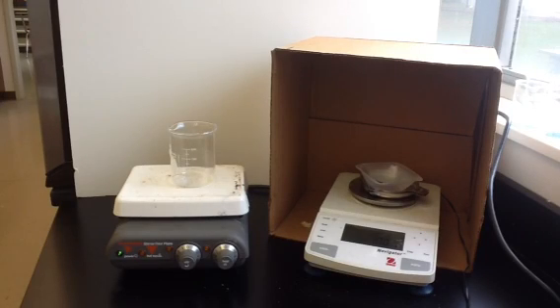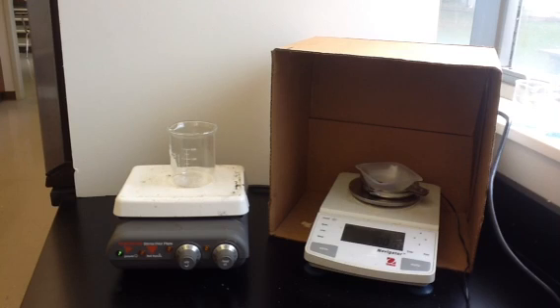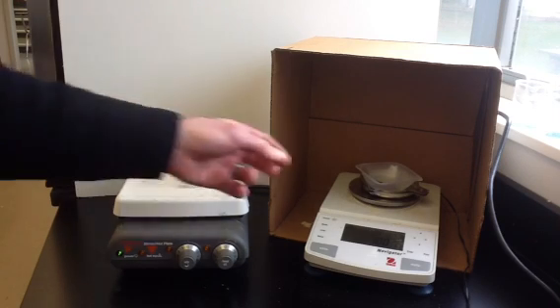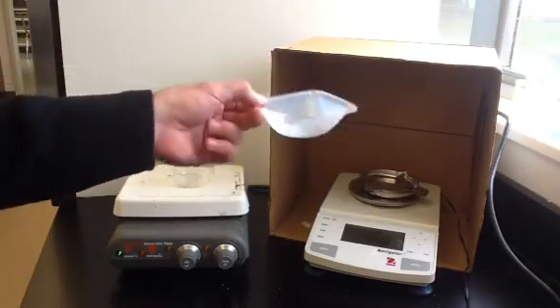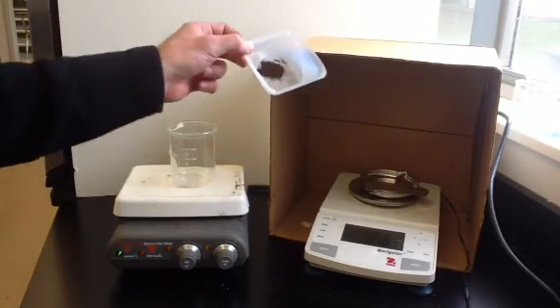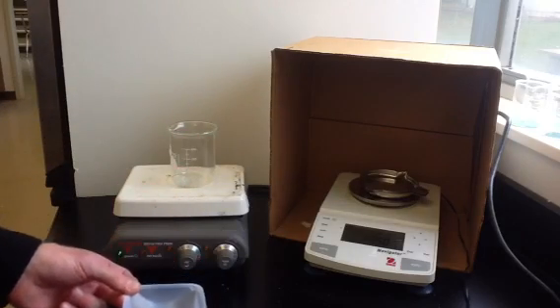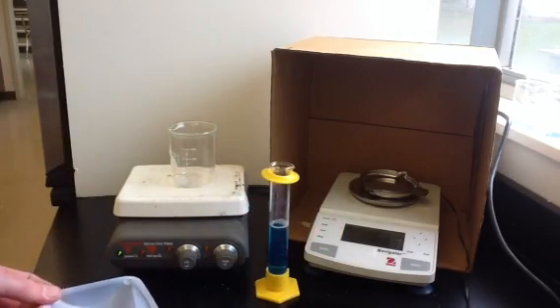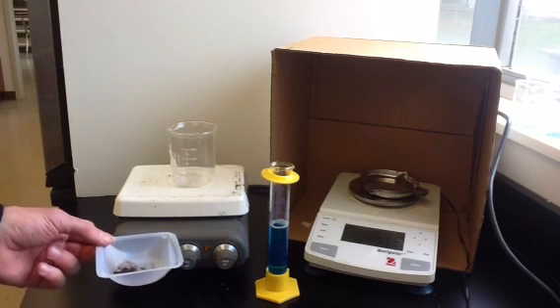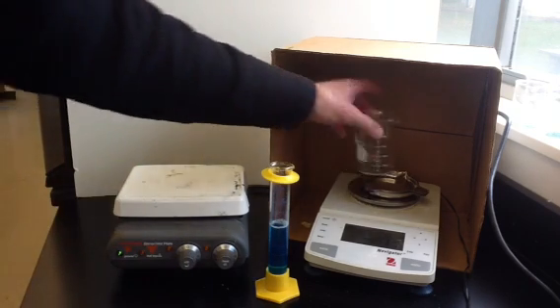This lab is the copper and iron stoichiometry lab where we're going to find out the formula for iron sulfate. We're going to let the iron filings react with copper sulfate and see if the product is iron 2 sulfate or iron 3 sulfate after the reaction goes to completion.